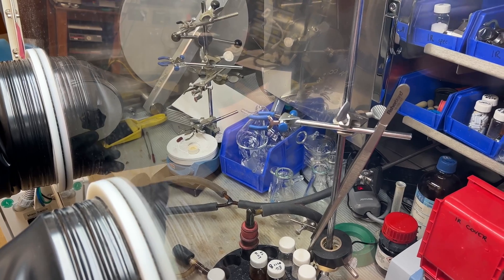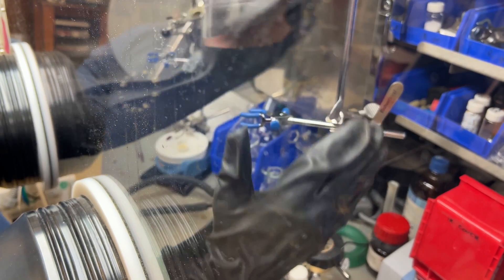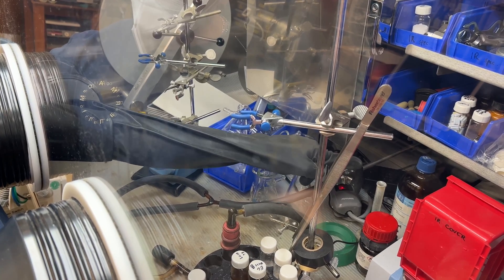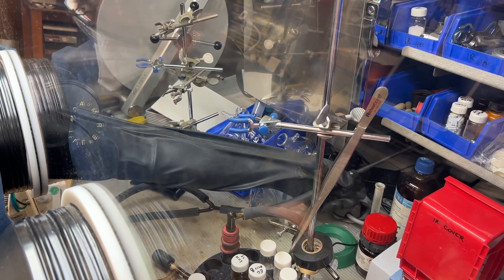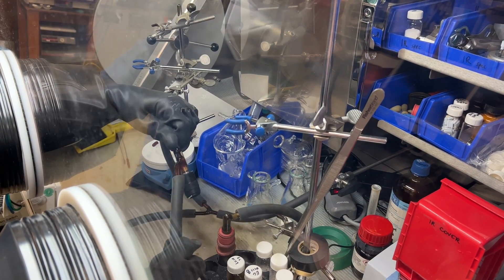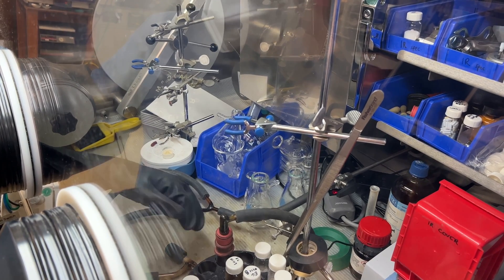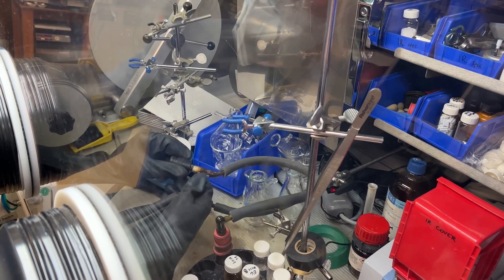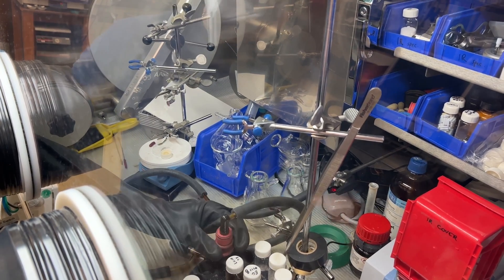Now that the cold trap is ready to go and all set up, we're going to go ahead and enter our glove box. Starting from the main valve, which is closest to the back of the glove box — right now it's in the perpendicular, closed position — we want to turn it towards us into the parallel position, opening up the valve. Now vacuum will be up to the secondary valves. For example, when we want to pull off solvent or dry our solid product, we're going to place our red septa on the top of the vial and open up our valve lefty-loosey.